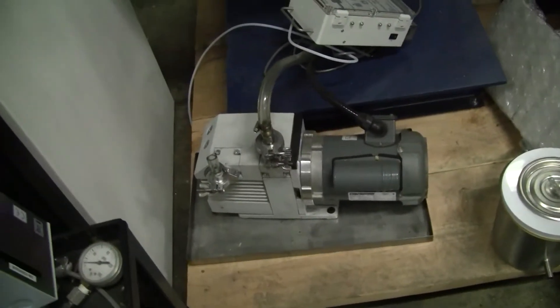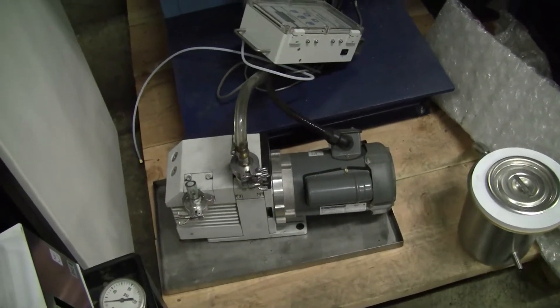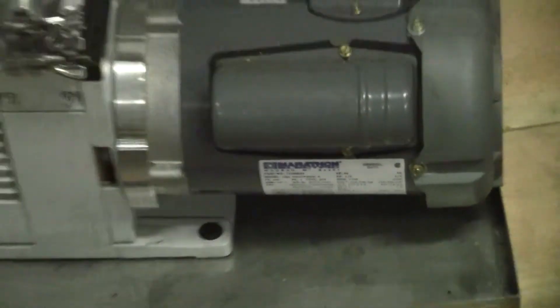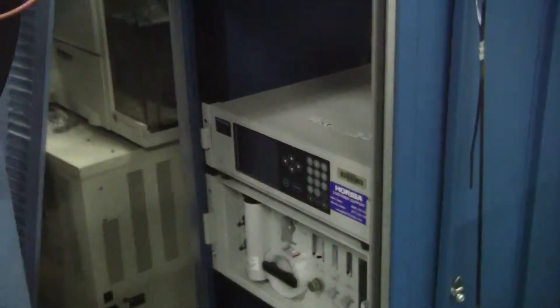We've identified that most to all — 99% of the major components on this device work on 220V, 50 hertz cycles. We've looked at the motor on the vacuum pump — checks out. The Horiba gas analyzer checks out.